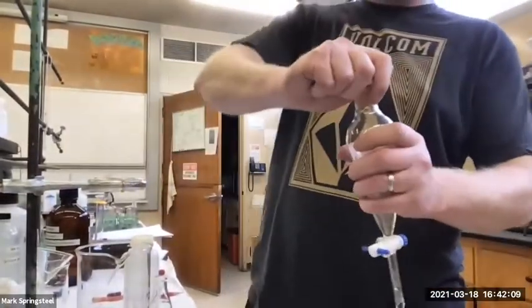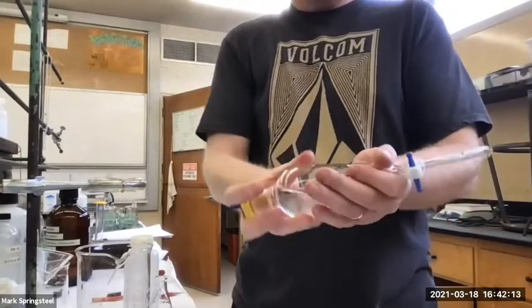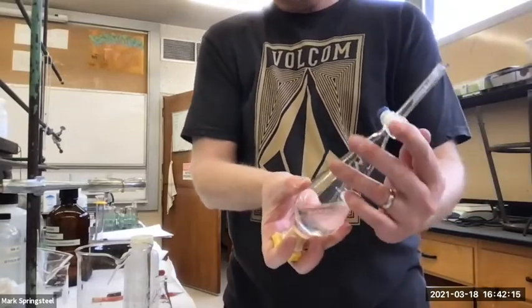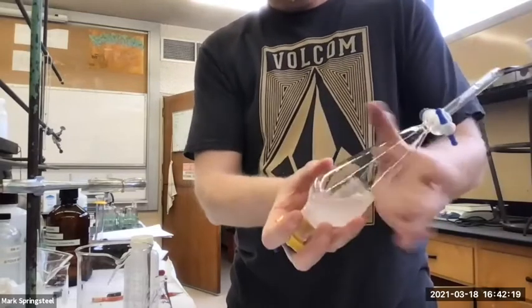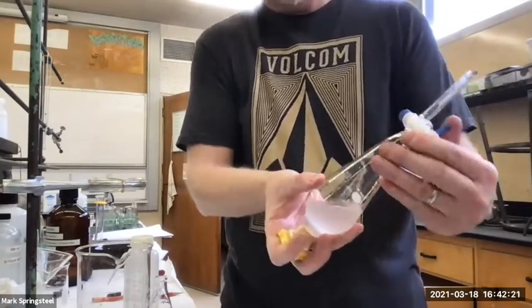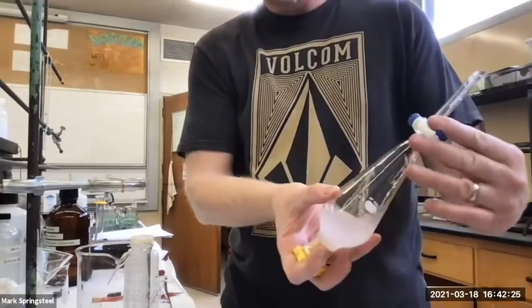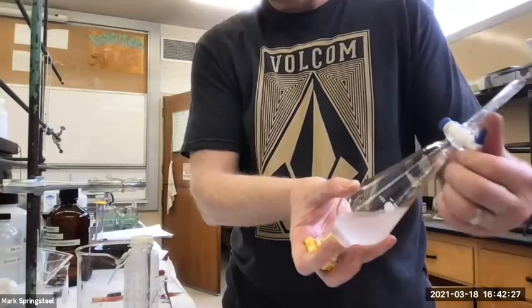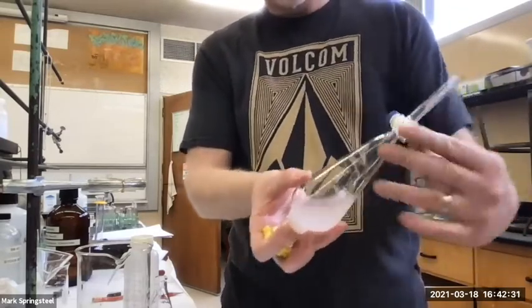Okay, cap it nicely. Hold on to the cap and then pull the cap down as I tilt it upside down. Vents away from me. Give it a little shake. Vent. This one's not venting too strong. It's okay. There we go. Vent.